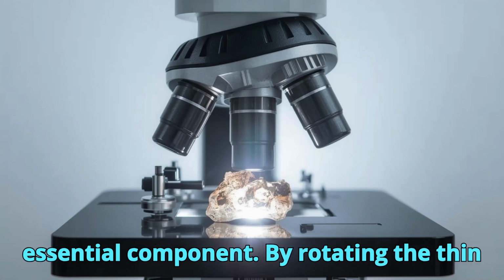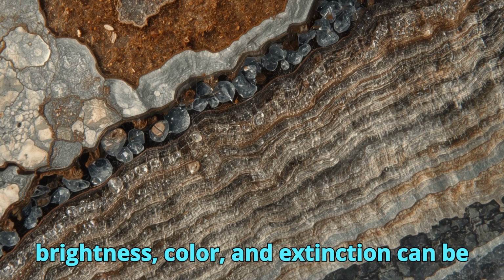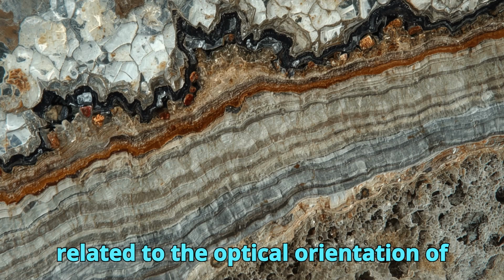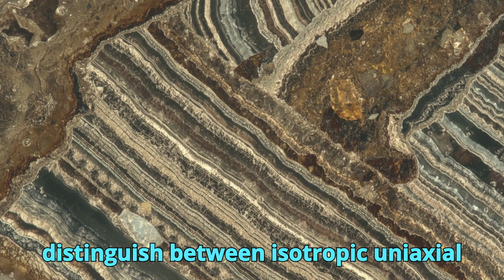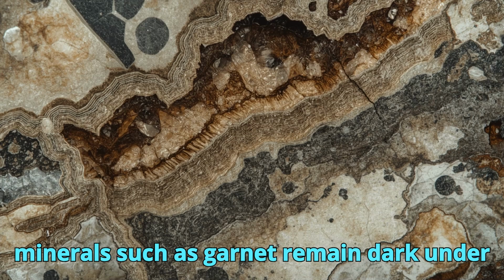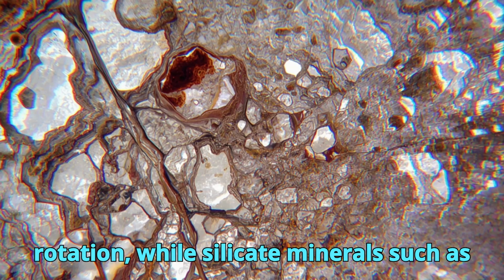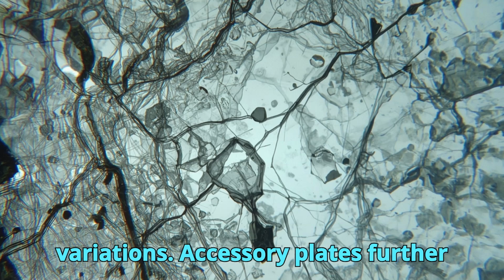The rotating stage of the petrographic microscope is another essential component. By rotating the thin section through 360 degrees, changes in brightness, color, and extinction can be observed. These changes are directly related to the optical orientation of minerals and allow geologists to distinguish between isotropic, uniaxial, and biaxial minerals. For example, cubic minerals such as garnet remain dark under cross-polarized light regardless of rotation, while silicate minerals such as quartz and feldspar show systematic variations.